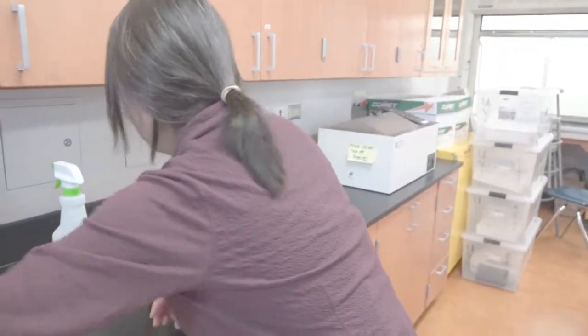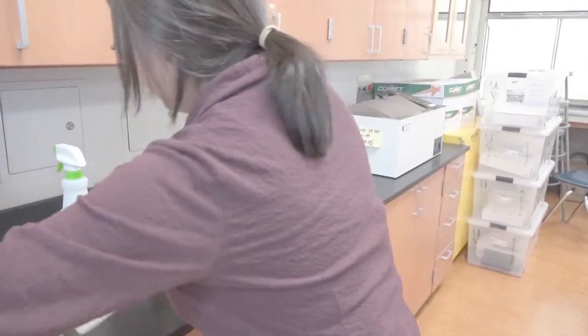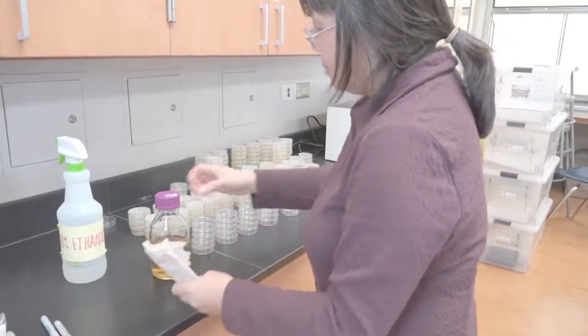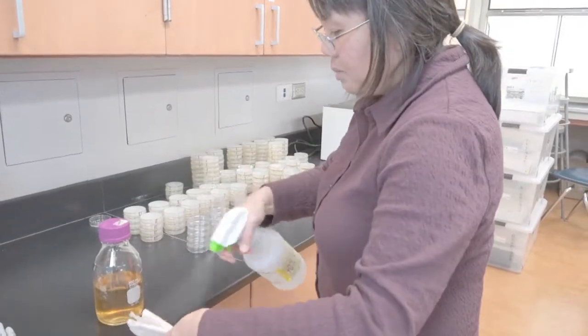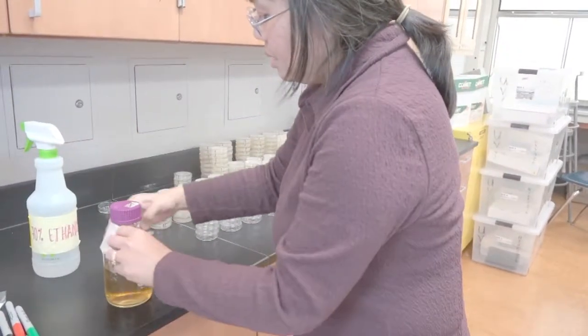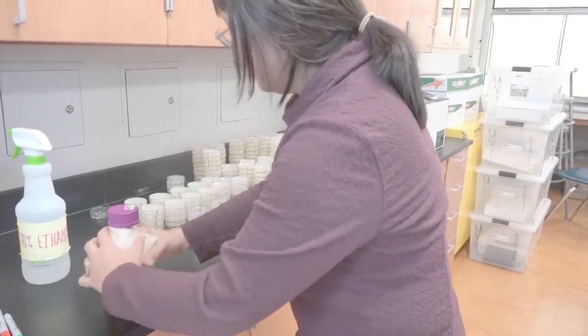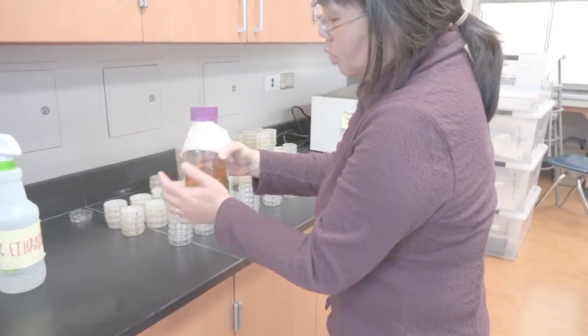What I like to do is get a strip of paper ready because I'm going to make a collar so it will catch any drips that come down. I like to spray my bottle first as well as my strip of paper. This is my collar, like what you do with a wine bottle.